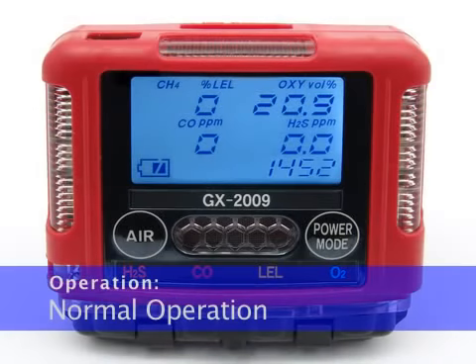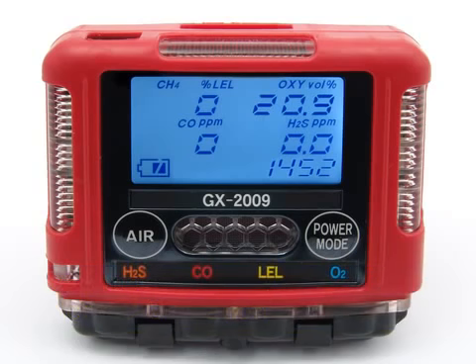When the GX2009 comes out of its startup sequence, it enters into measuring mode and is in normal operation if no alarm conditions are taking place. In the normal operation screen of measuring mode, the battery level, time, and gas concentrations for each channel are displayed on the LCD. The time is in the lower right corner and the battery level is in the lower left corner. Combustible gas is displayed as a percentage of the lower explosive limit, %LEL. Oxygen is displayed as a volume percentage, vol percent, H2S and CO as parts per million, ppm.